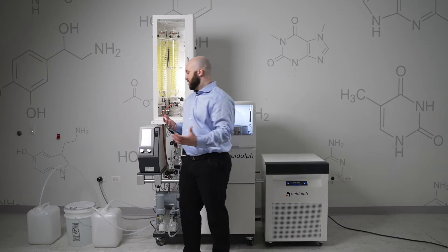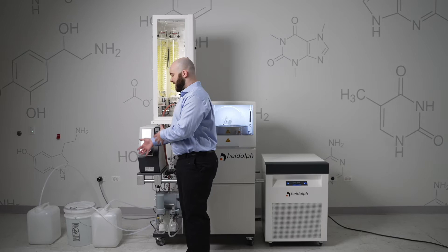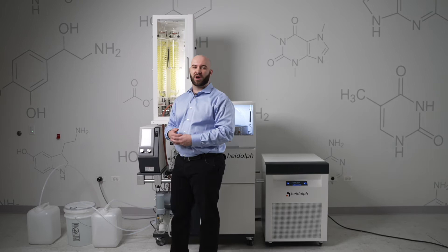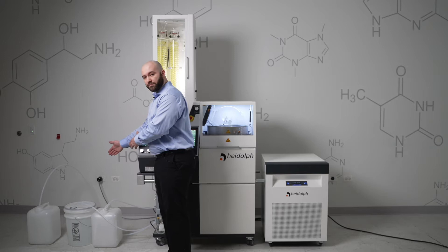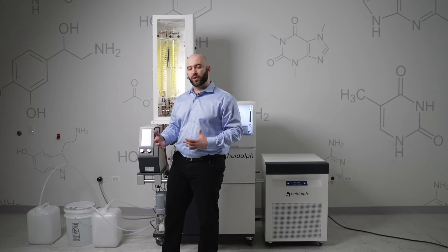To get started, you'll see these three carboys to my right. These are basically what's taking place as your amount of product that can be distilled or evaporated at a time. I've got five-gallon carboys here, but you could have 55-gallon drums if you want to run this process overnight, for example. Our first, in the middle, is our initial product or what we like to call the educt — that is what's going to be sucked into your evaporation flask.